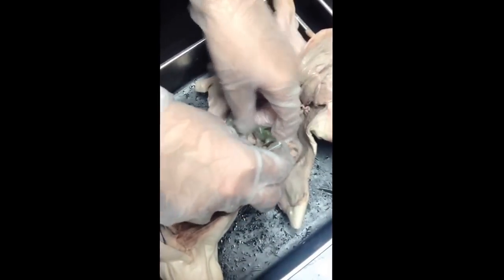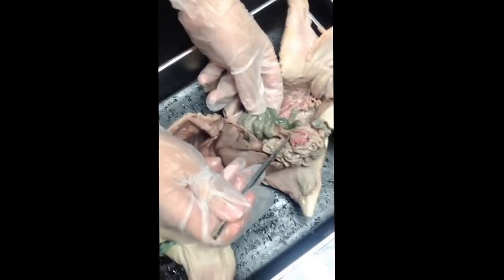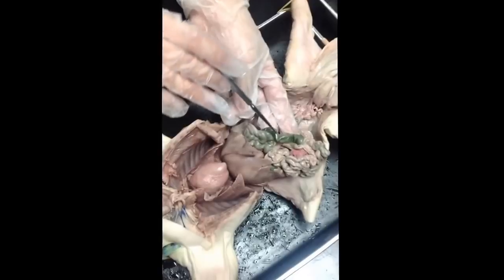They have an ileum too, just like humans do, but I didn't put it on your list because sometimes it's tricky for students to find it. But this last segment, that's the ileum. Right around where my pointer is, that's where the ileocecal sphincter would be. So we lead it to the large intestine.